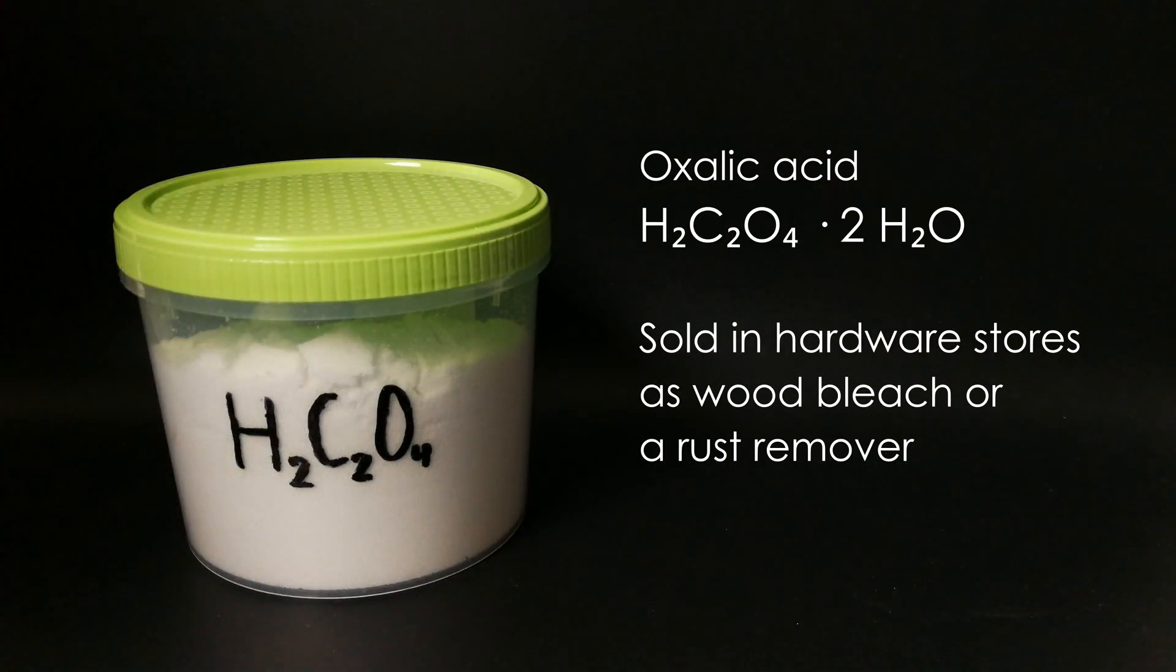Oxalic acid dihydrate is most commonly found in hardware stores where it is sold as wood bleach or a rust remover. Where I live, however, it is not as easy to find, so my oxalic acid is from a chemical supplier.